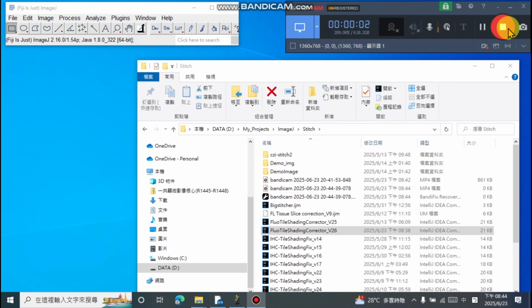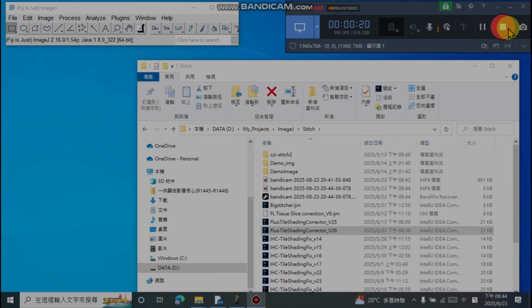This video will teach you how to use the Fluor-Tile -Shading-Corrector, to recalibrate the background of the tiled images and complete the stitching process. The tool will use two other important plugins in ImageJ, Basic and Big Stitcher.